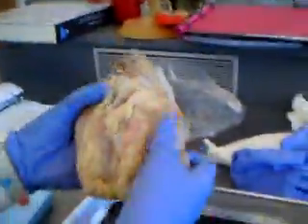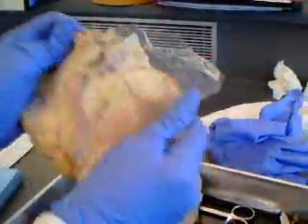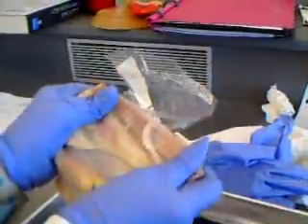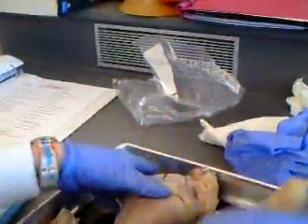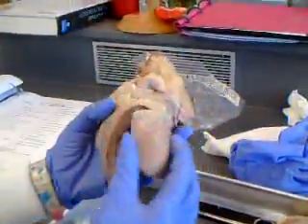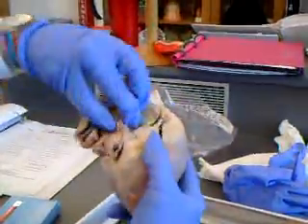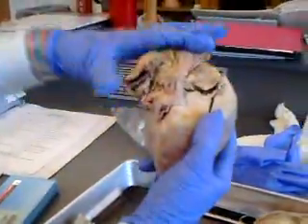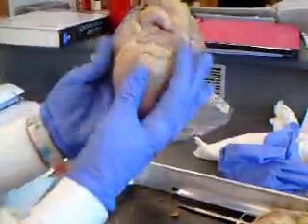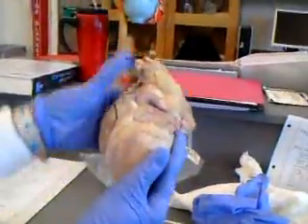All right, so we'll start with the parietal pericardium, or the fibrous pericardium, which was at one time around the heart. Now it's not. But you can feel how tough and fibrous it is. Let's see, how do we determine anterior and posterior? The posterior side's a mess, where all the cut vessels are, and the anterior side's more neat and smooth. So that's how you can orient yourself.